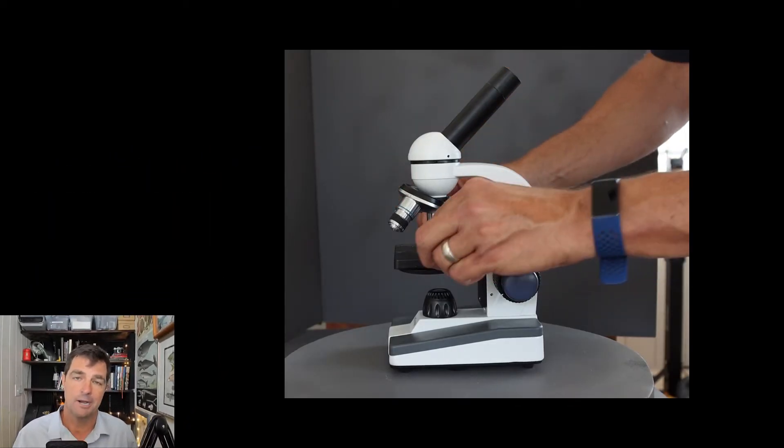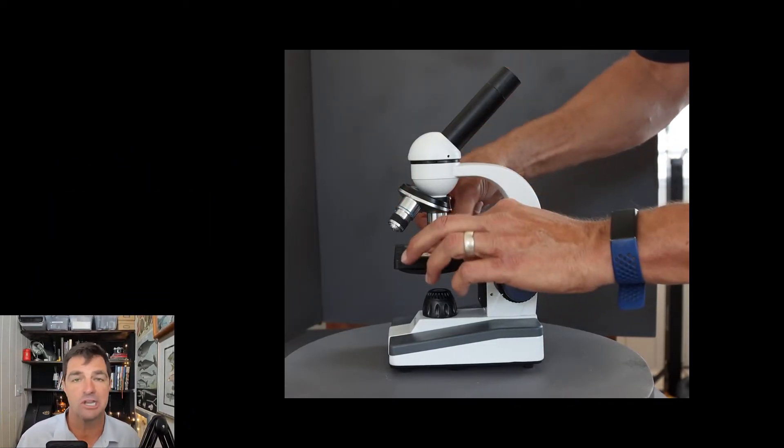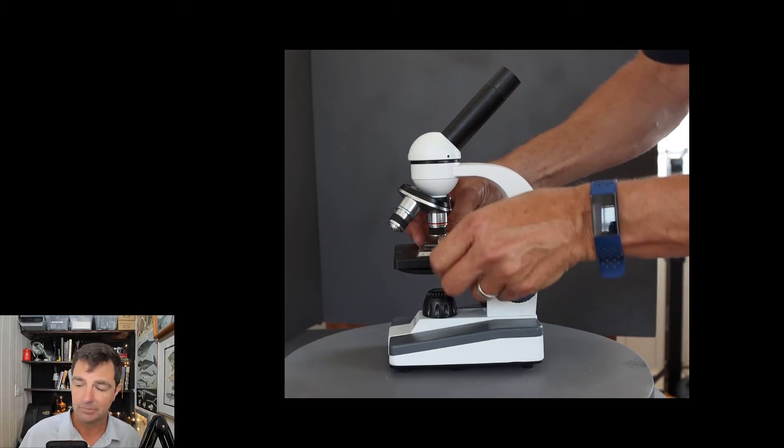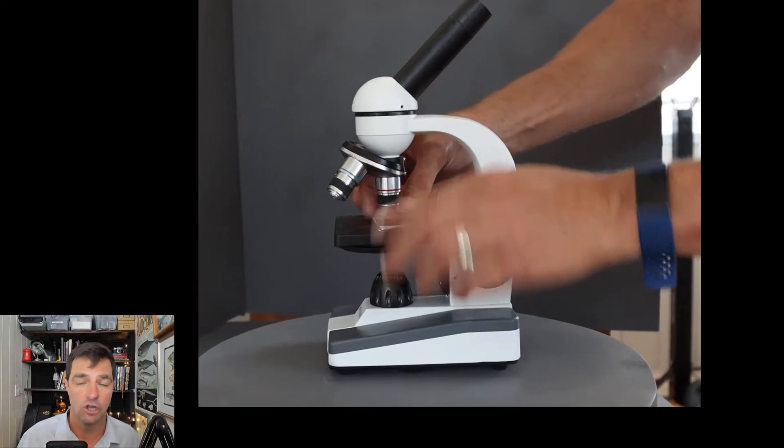To focus your microscope, put your slide on the stage and always start on low power.